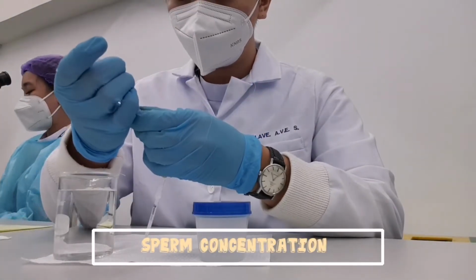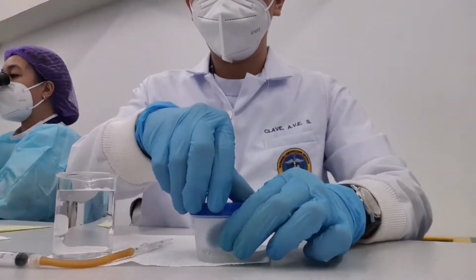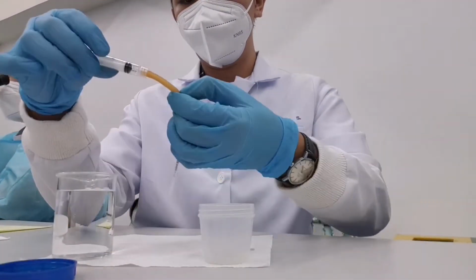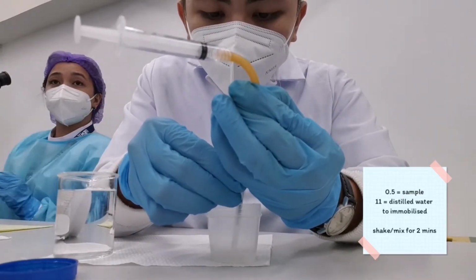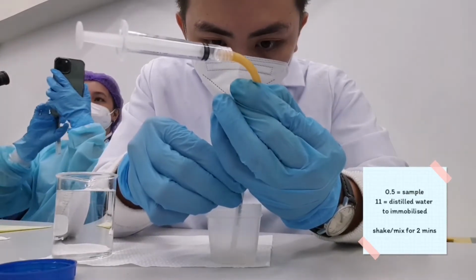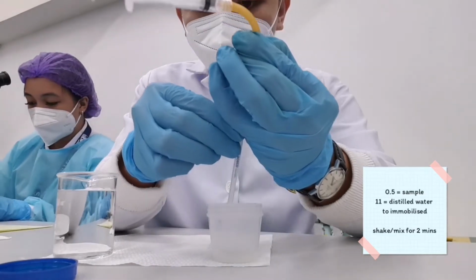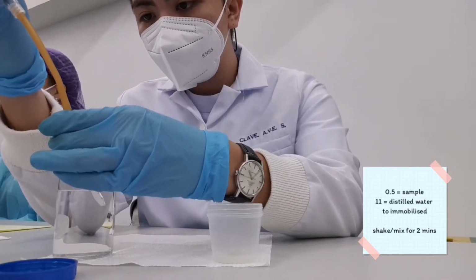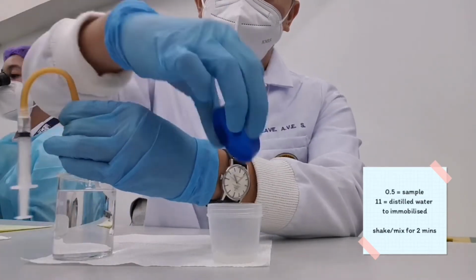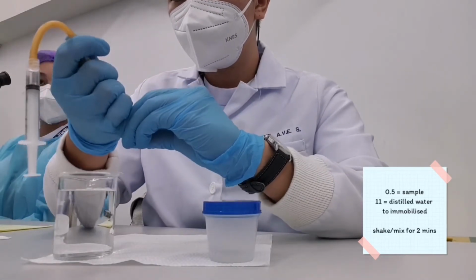Next would be sperm concentration. Before starting, make sure that the pipette is clean and has no liquid inside. Then, pipette a sample up to 0.5 mark. After doing so, add distilled water up to 11 mark to immobilize the sperm. Then, mix it for 2 minutes with the use of pipette shaker, or you can shake it manually by hand.